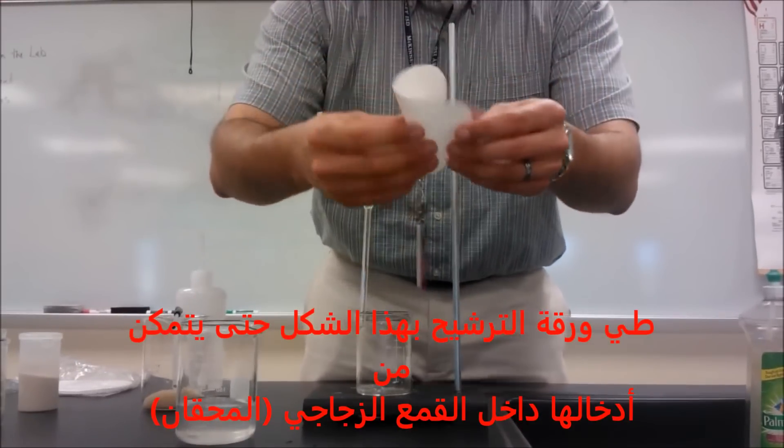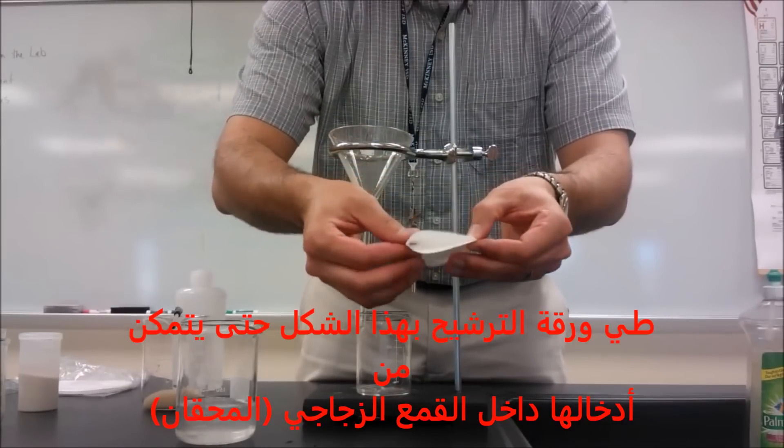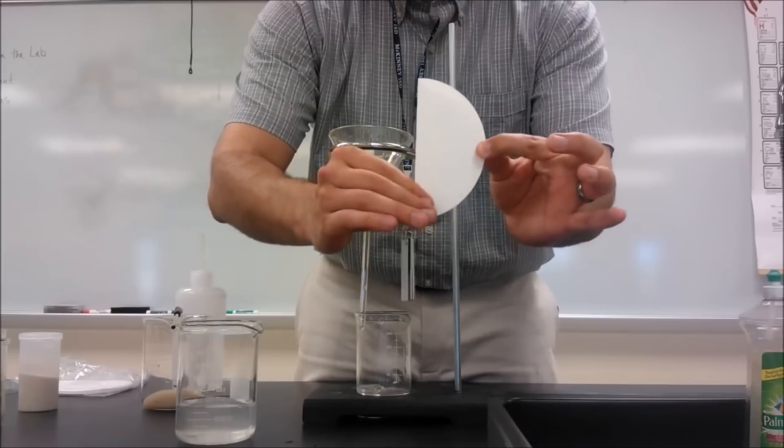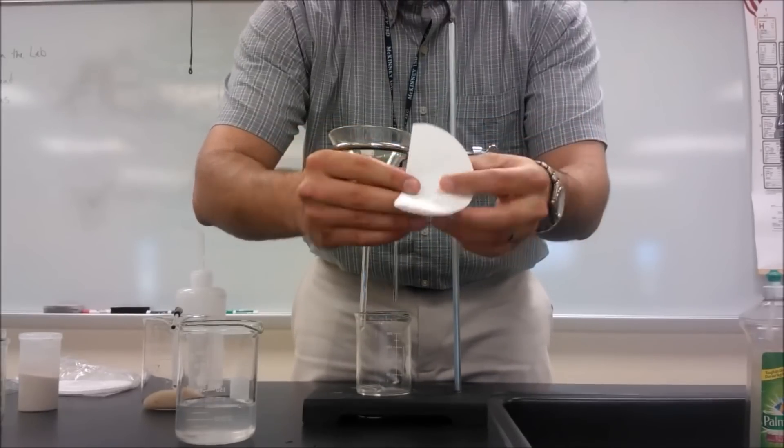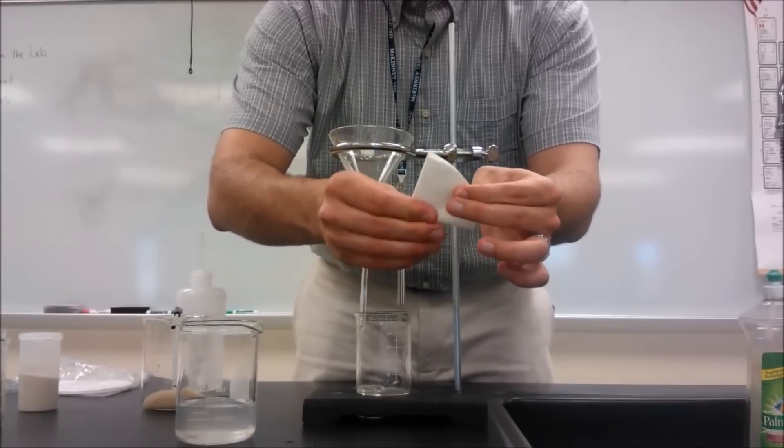Alright, so now I'm going to fold my filter paper into quarters. So here I folded it into half. So here I fold it into half, and I'm going to fold it into half again. Okay, fold it into half again.